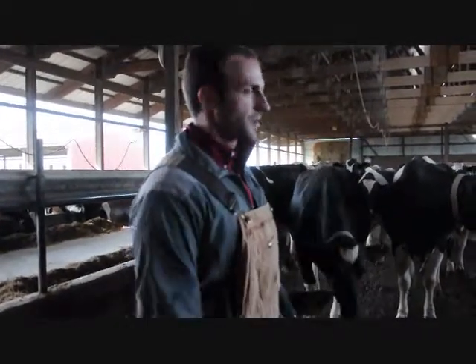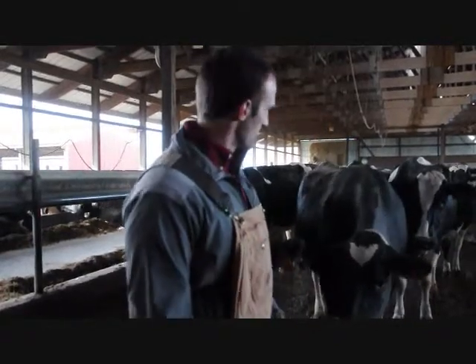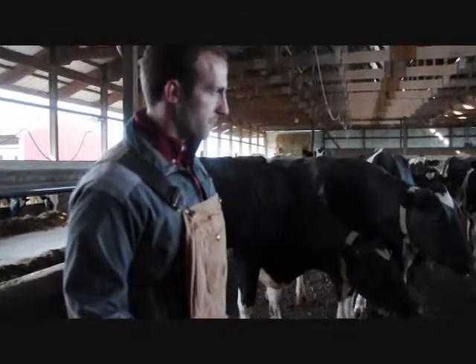When we're taking the samples, we're going to want to get a good distribution of manure, whether it be loose, average, or stiff piles. You can see we've got very friendly cows here today, so be careful and safe when working with pens.